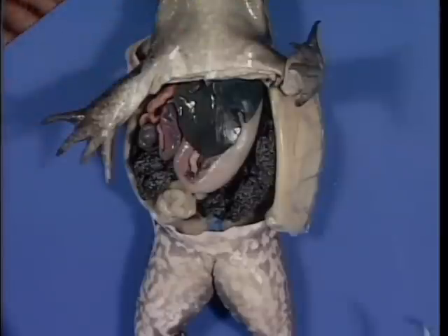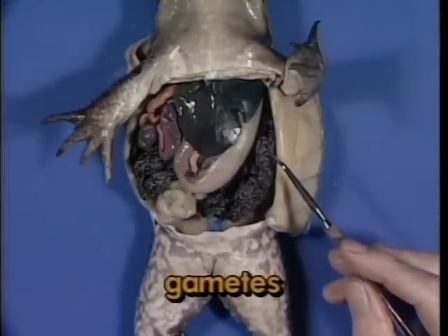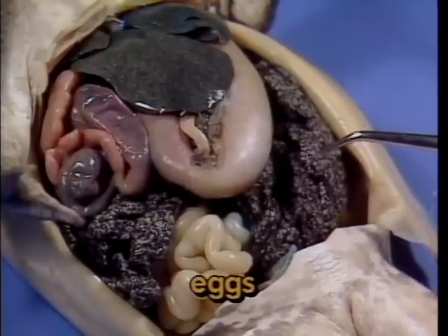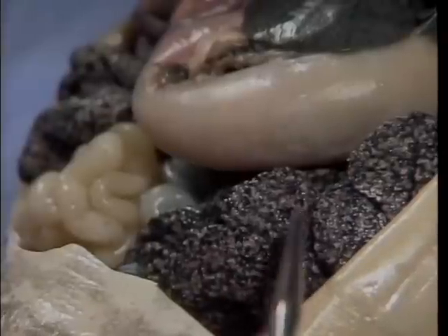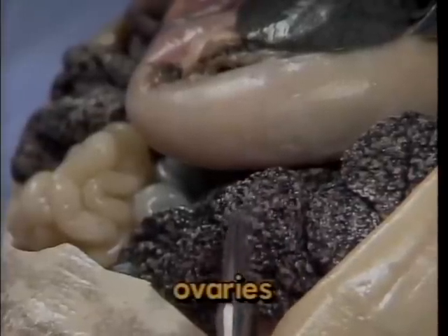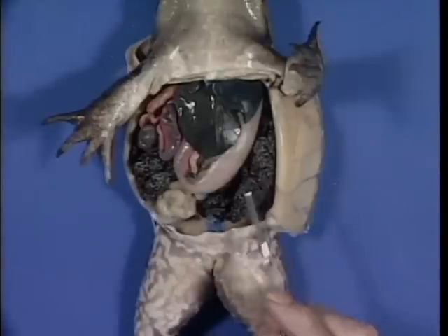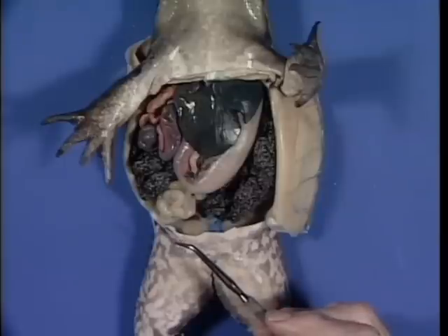Female bullfrogs produce from 5,000 to 10,000 or more gametes called eggs in a single breeding season. Here each small dark sphere represents a single egg. All of those seen here are contained within the paired ovaries. Unlike males, females rely on a duct separate from the urinary tract to transport eggs to the cloaca.